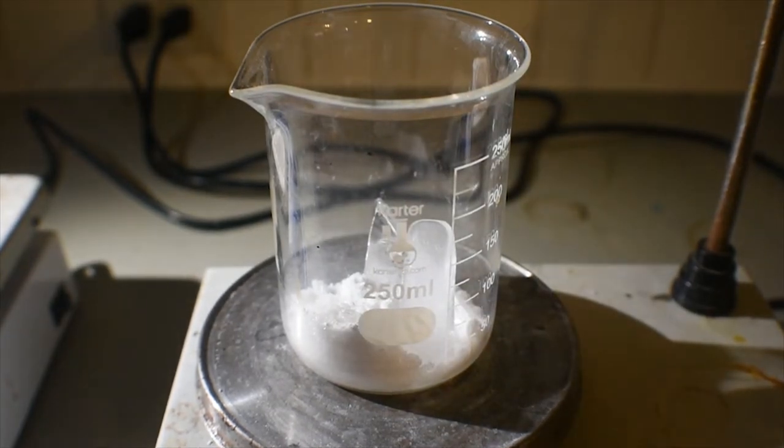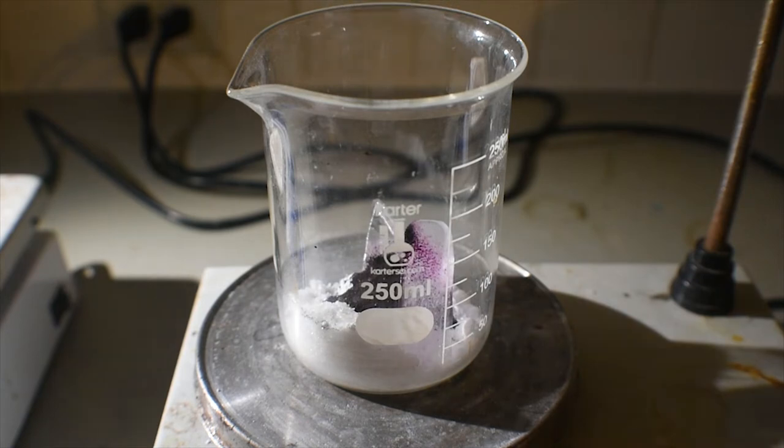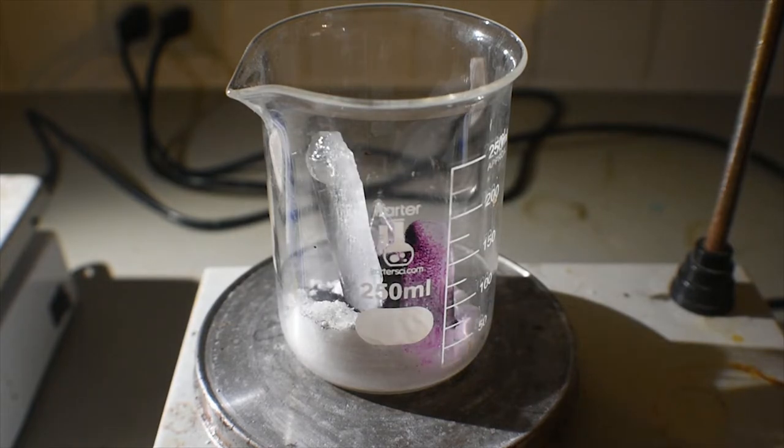So, now I'm going to add the potassium permanganate, and then I'm going to dump in a lot of ice.